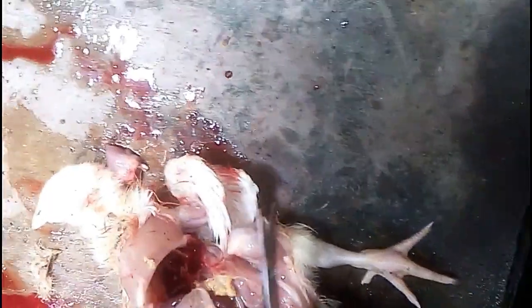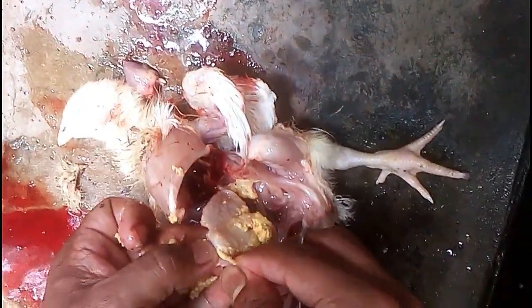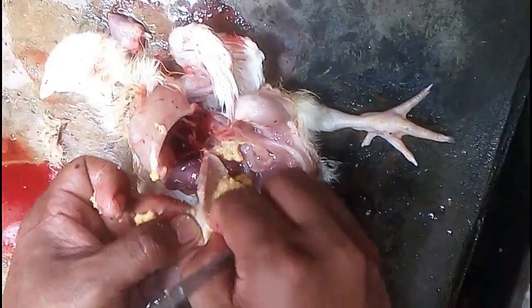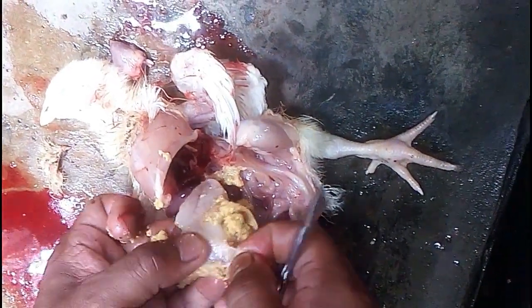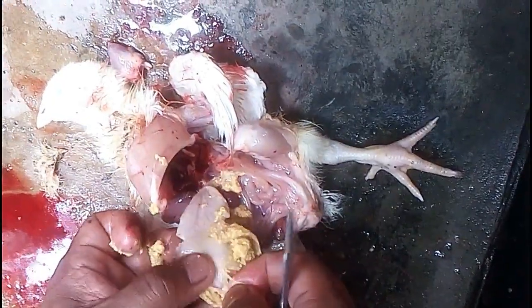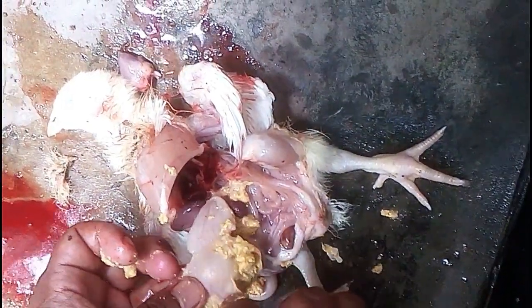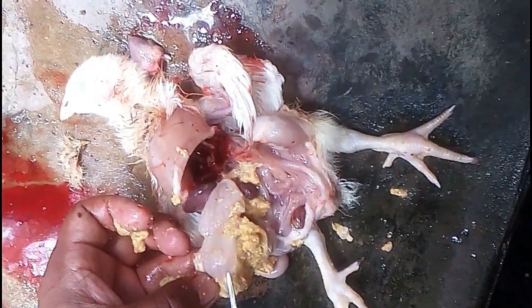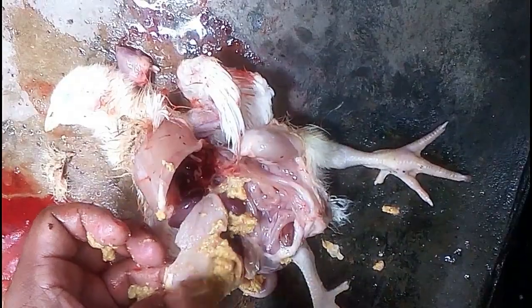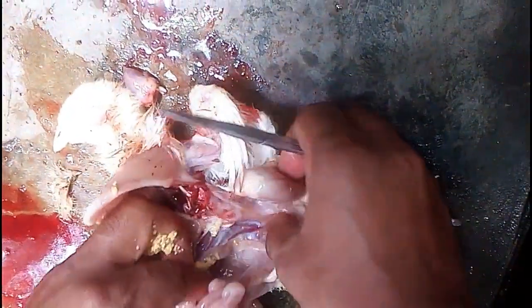Next, we open the gizzard and we try to rub out the layer of the gizzard. If it is easily rubbed out or easily picked out, then we can say that it is caused by toxin.